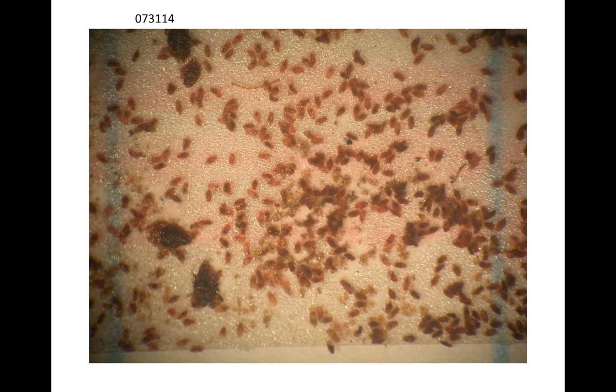John, here's a dumb question. For the double-sided sticky tape, there's one side with the crawlers, the other side without the crawlers. Well, in reality, there may be some crawlers that get under the tape, but since it's relatively clear, you can actually see through the tape.